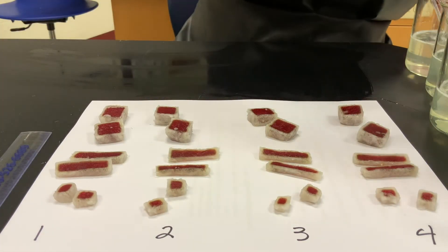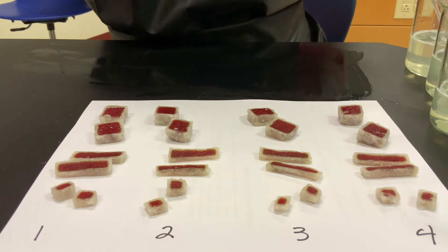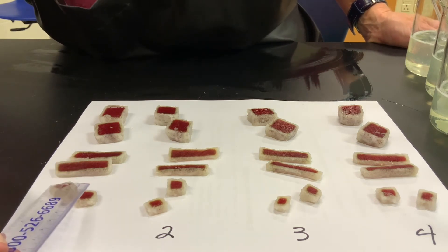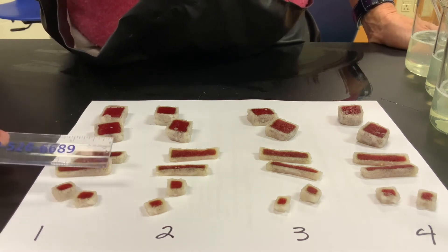I have to use my regular glasses — there's no way I can see this without them. Starting with the 1 by 1 by 1 cube, it shows 2 millimeters of diffusion on both sides.